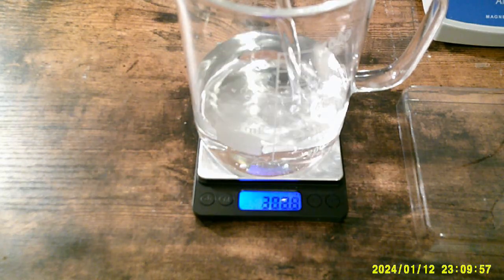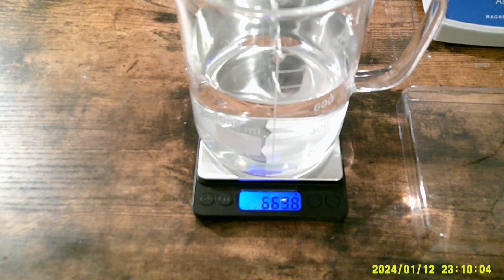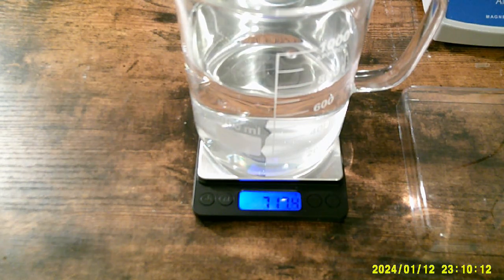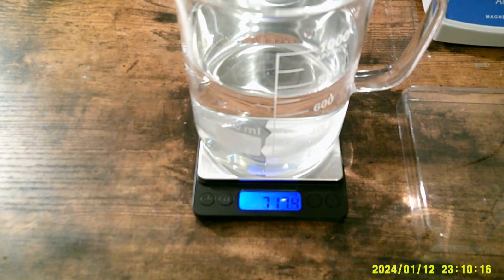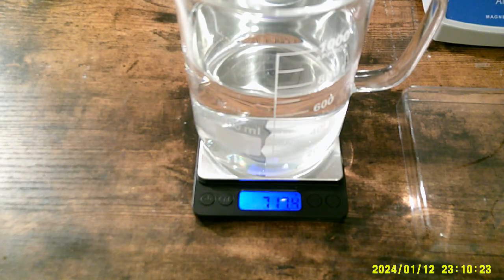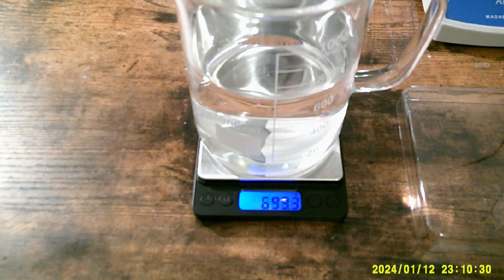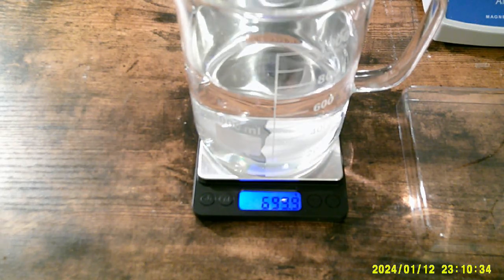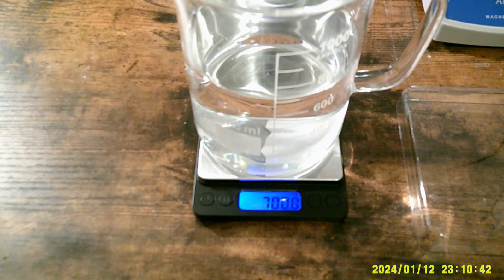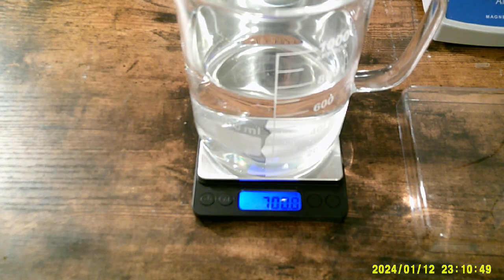And yes, this is a beaker that has a handle on it. You could use it as a coffee cup, but I don't. That's a little too much, so I will get some of that out. I have a means, it's not really good means, but it is a means. Oh my gosh. There we go. That is pure luck, but really good pure luck. Okay, now that I've got the 700 grams of water.